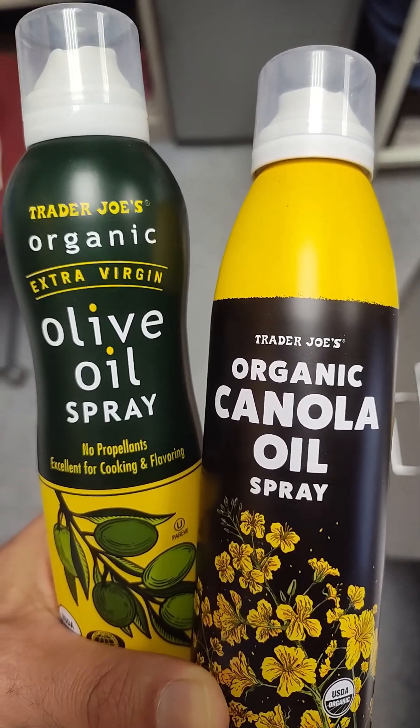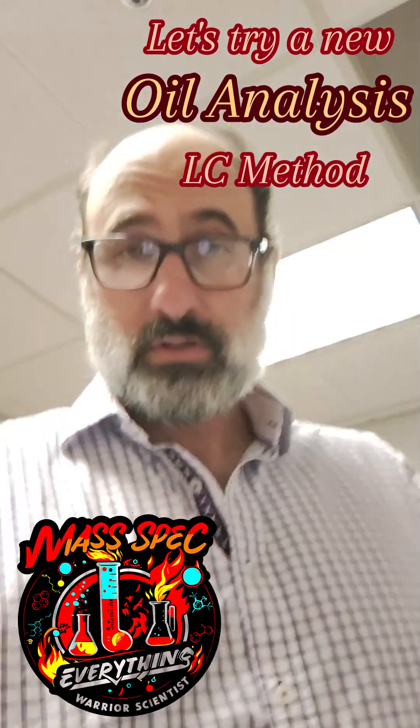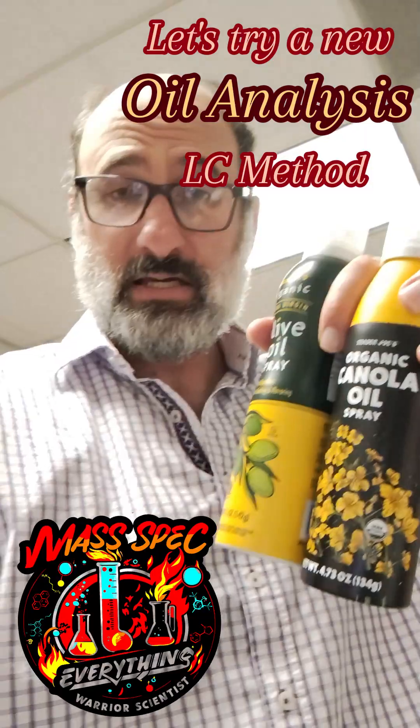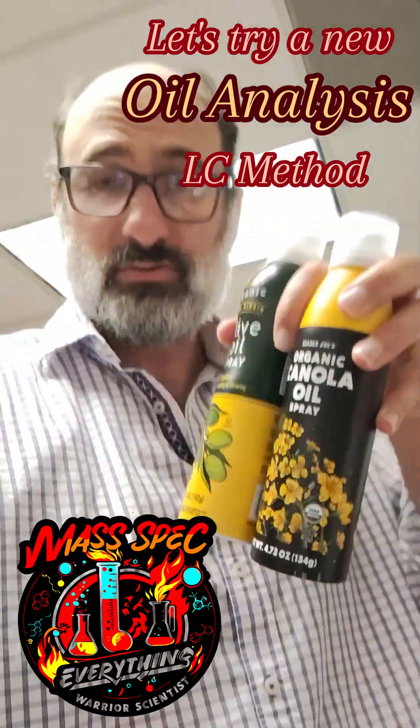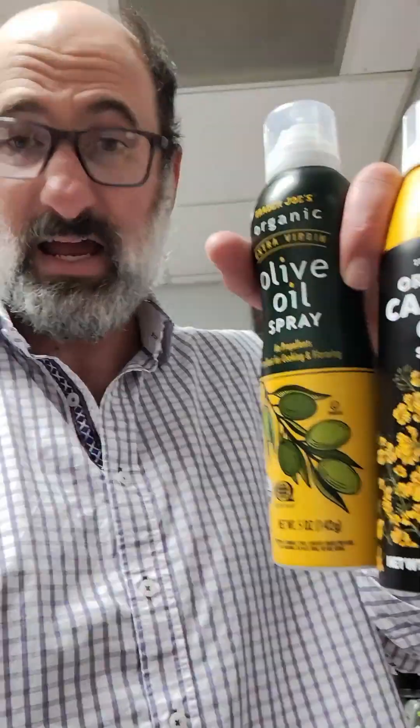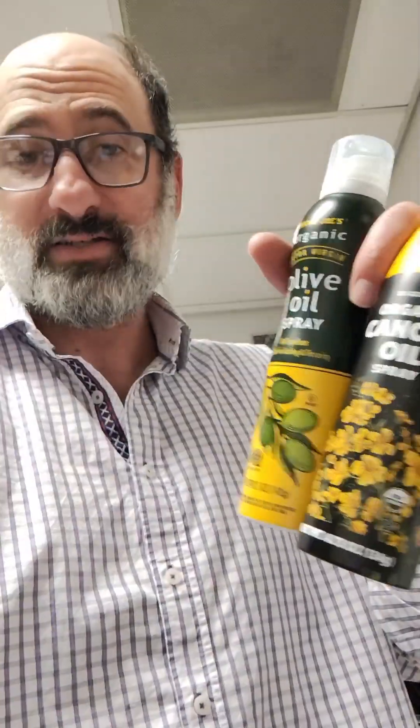Let's try our oil extraction method on these two oil sprays. For all my new followers that AVE sent my way, I do not have the Kirkland brand olive oil yet, but I do have Trader Joe's right near the office. I got the olive oil spray and the canola oil spray.